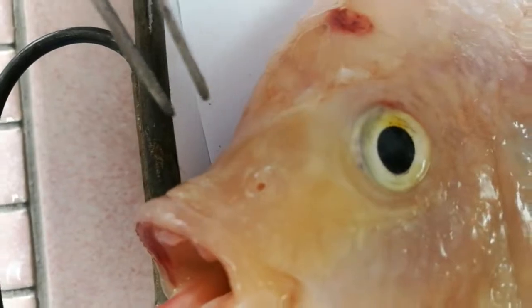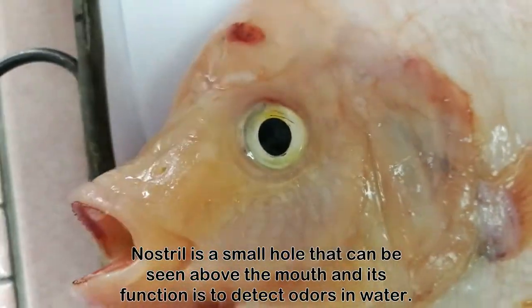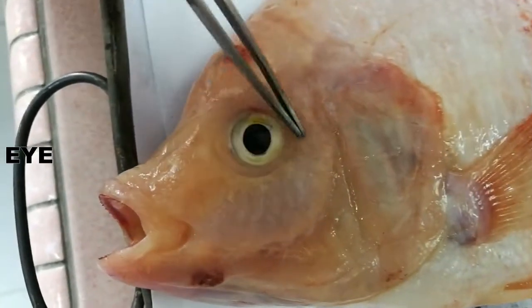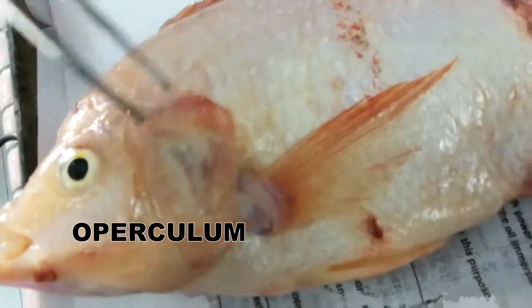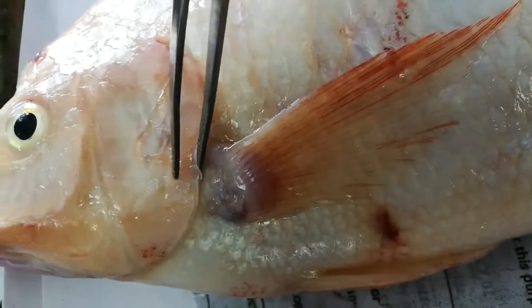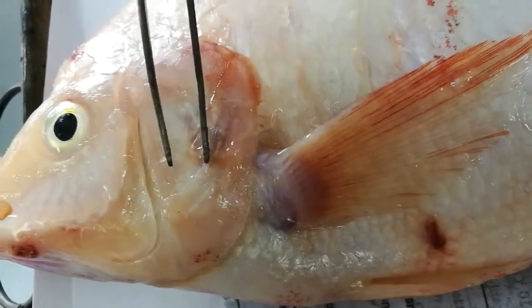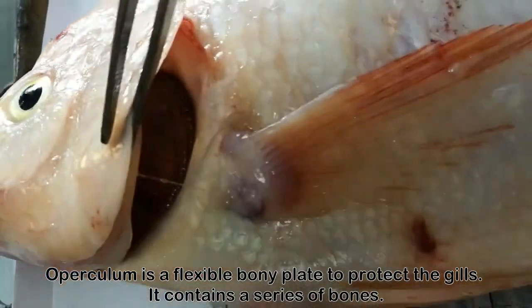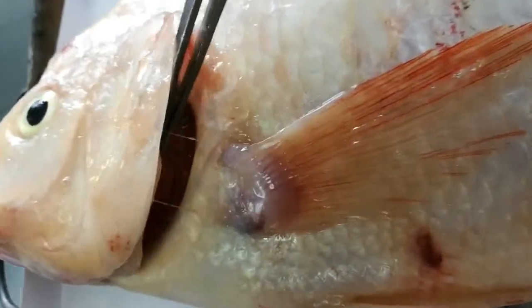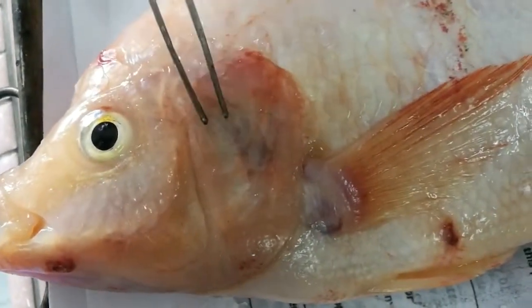The nostril functions to detect odors in water. The third feature is the eye, and the fourth is the operculum. As you can see, the operculum here has a bony type — it is a flexible bony plate to protect the gills. You can see underneath it there is a gill, and there are several bones that make up the operculum.